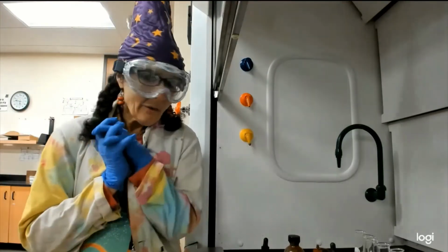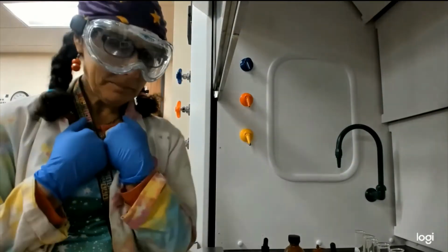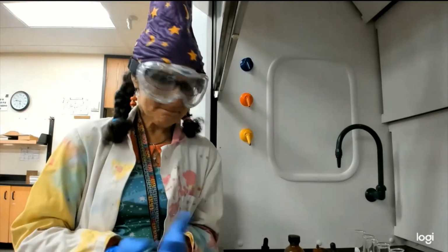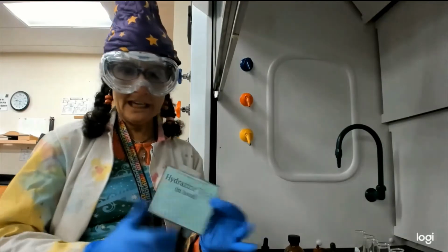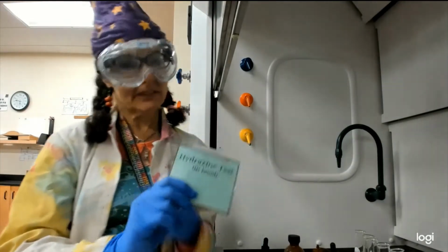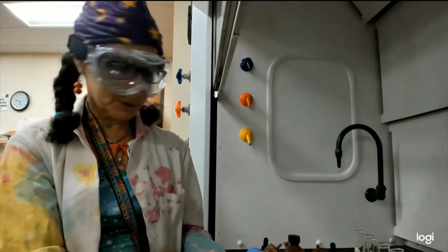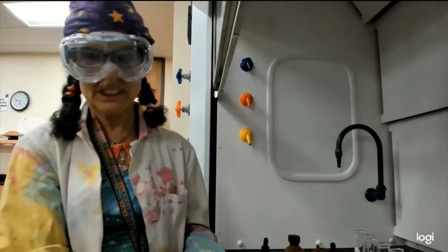And here we are, organics to organics, or qualitative analysis in the lab with me, your teacher. And we're going to go through 7 different tests and see a visual for what happens. So our first test is called the hydrazine test, for short, or we will call it by its full name. It's a tongue twister. 2,4-dinitrophenylhydrazine. There we go. Just hydrazine.